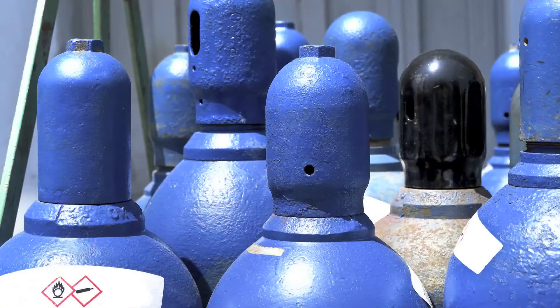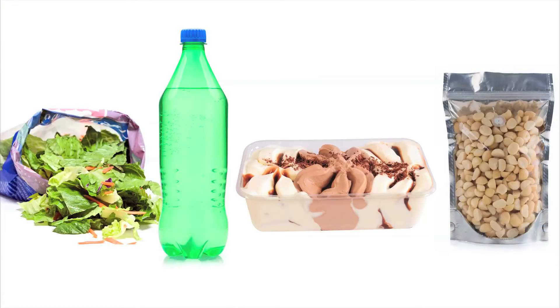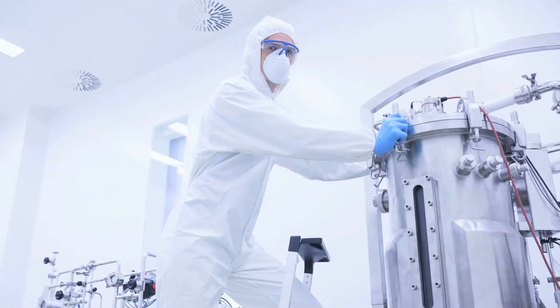You've now completed the gas phase calibration for your NeoFox probe system. There are many types of applications for this type of calibration, such as leak detection and compressed gases, the integrity of food packaging, and the study of the headspace for chemical reactions.